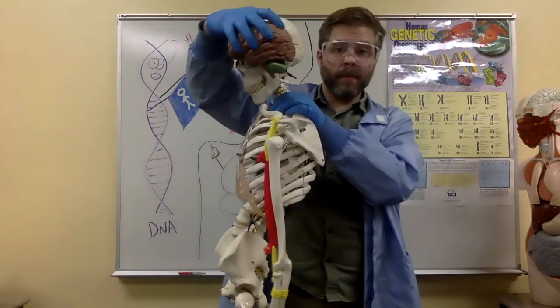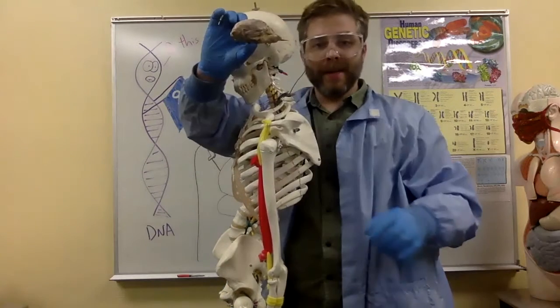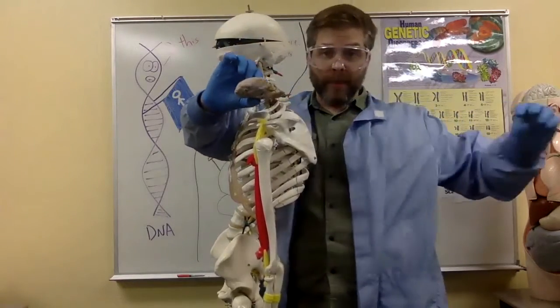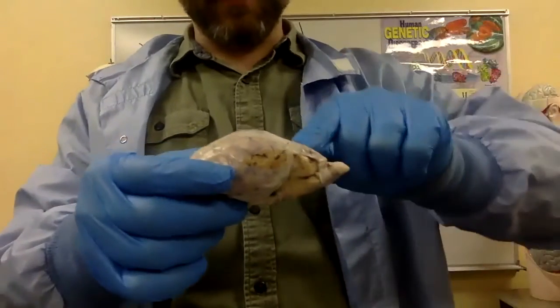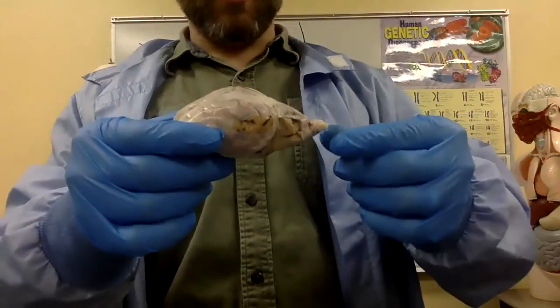Where the sheep doesn't stand up on two legs, it stands on four legs. So its spine is actually going to be going outward along its back. Its cerebellum, instead of being down here, is going to be pushed up here in the back instead of below. The brainstem goes out back too.